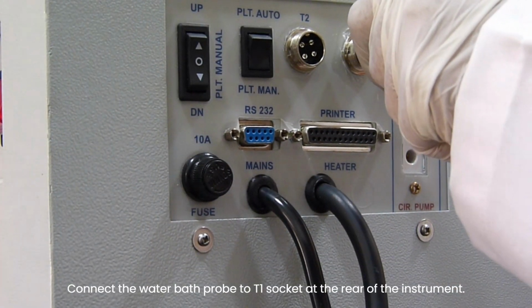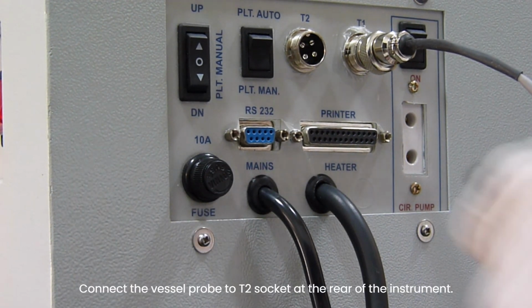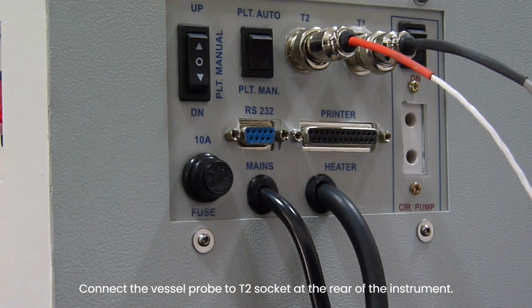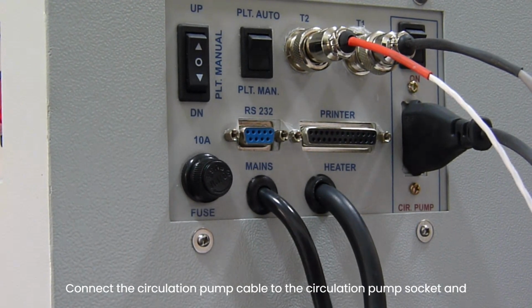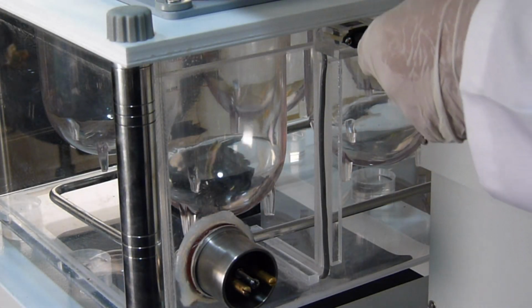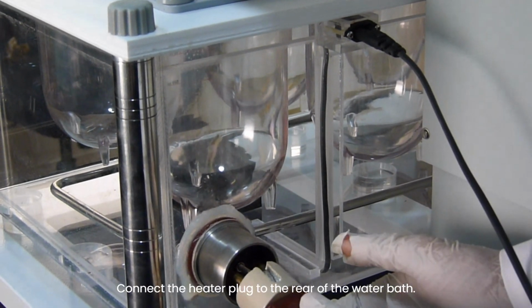Connect the water bath probe to T1 socket at the rear of the instrument. Connect the vessel probe to T2 socket at the rear of the instrument. Connect the circulation pump cable to the circulation pump socket and connect the other end of the cable to the water bath. Connect the heater plug to the rear of the water bath.